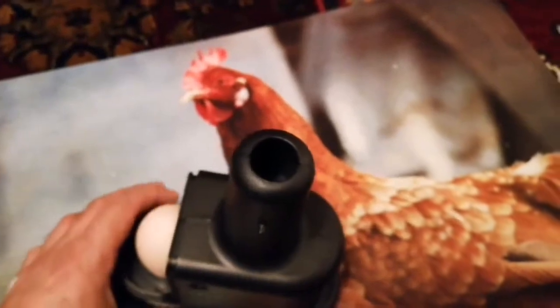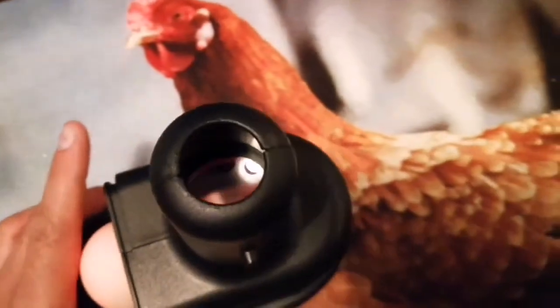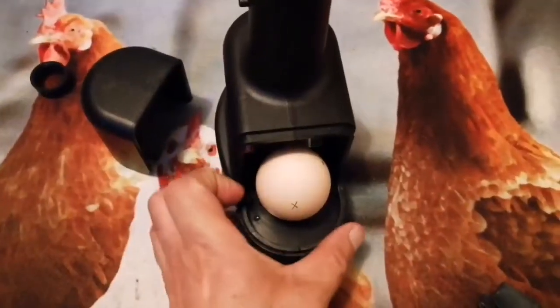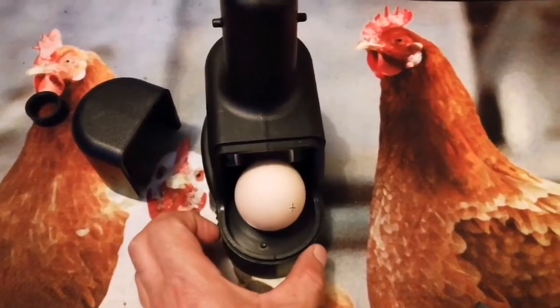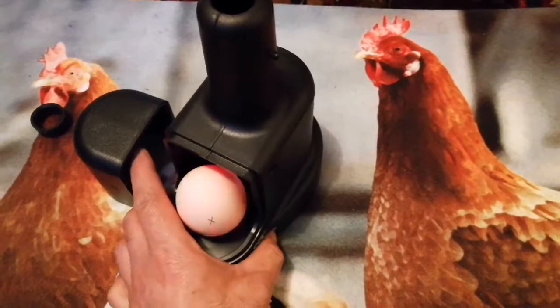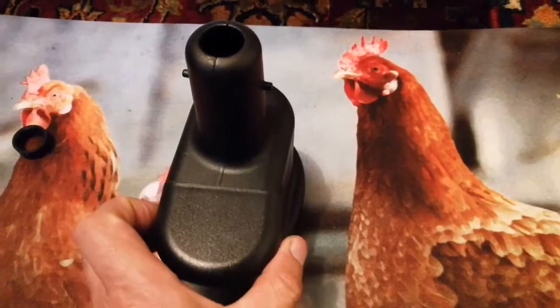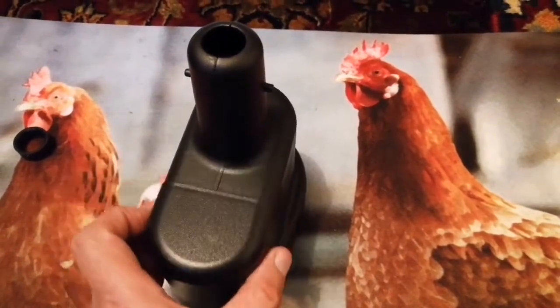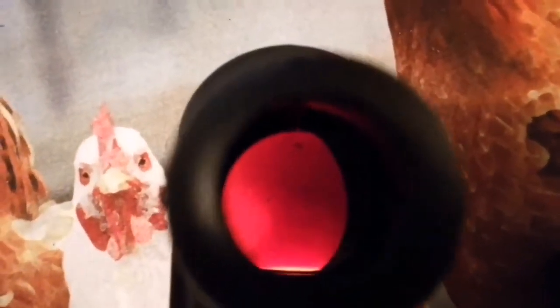I have moved one of those fertilized eggs and I'm going to put it in the ovoscope and turn the light on. There is a wheel here which actually turns the base so you can see all around the egg. We don't want to spend too much time messing around with the egg. Can you just put this here, Susan? Let me just look at the egg — oh, I see there's something there!